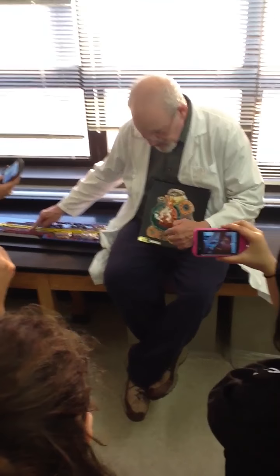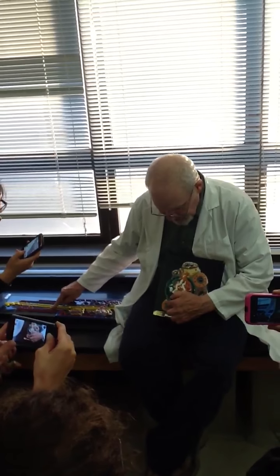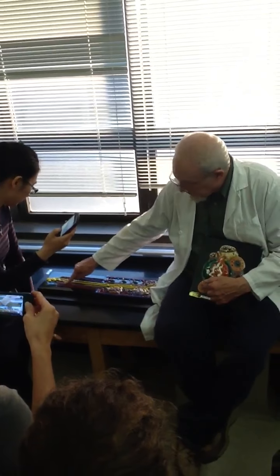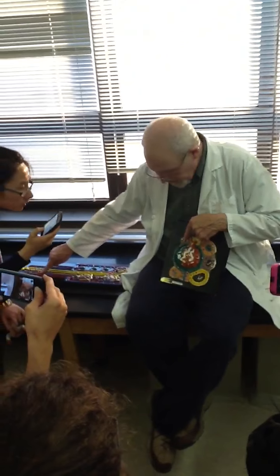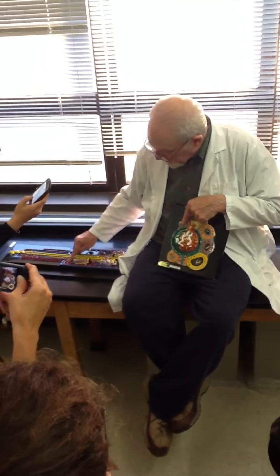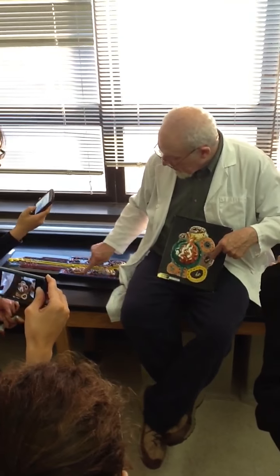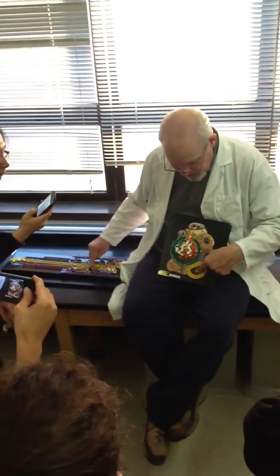You can see the lumen inside here is triangular shape. So this tells us I'm in my descending limb of the loop of Henle. I'm going to come down here and then come up this side, and this is going to be my ascending limb of the loop of Henle, which is purple right here. Descending limb, ascending limb, and then this is going to dump into the distal convoluted tubule, which is right here, and then this distal convoluted tubule, which is purple, is going to dump into the collecting duct right here.